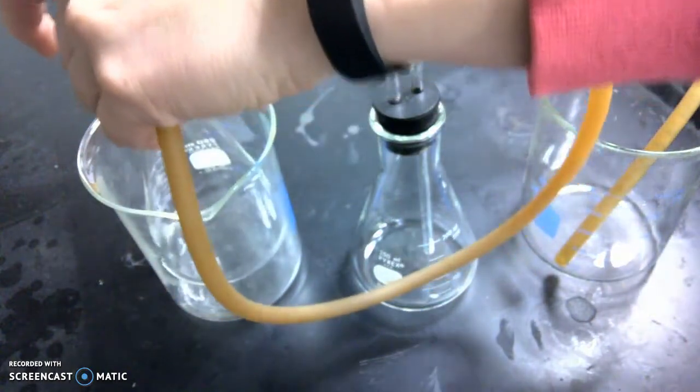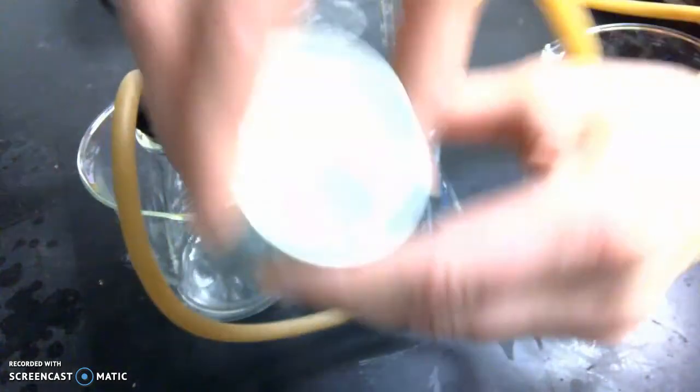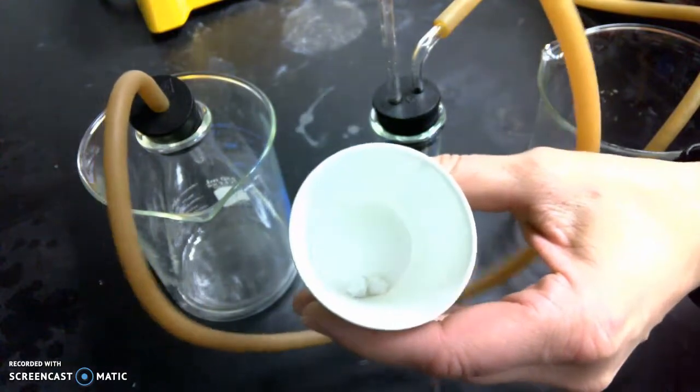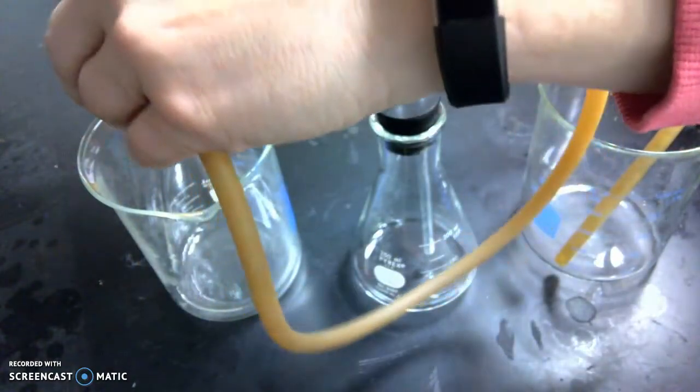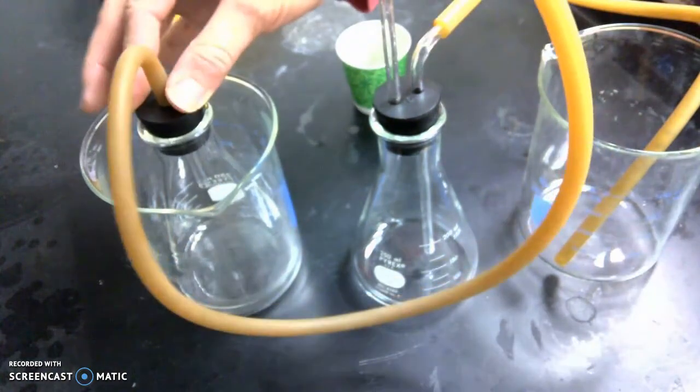You or your lab partner are going to drop the solid that's been pre-measured for you. You're going to drop it into the flask, and you're going to quickly cap the flask.